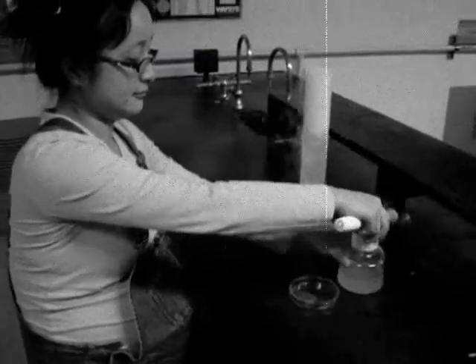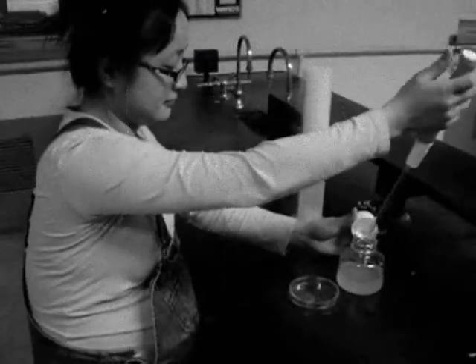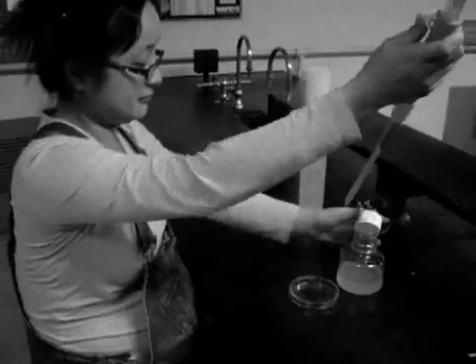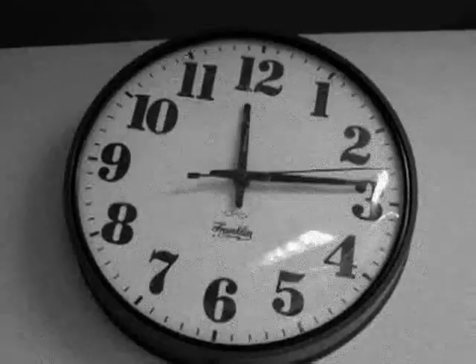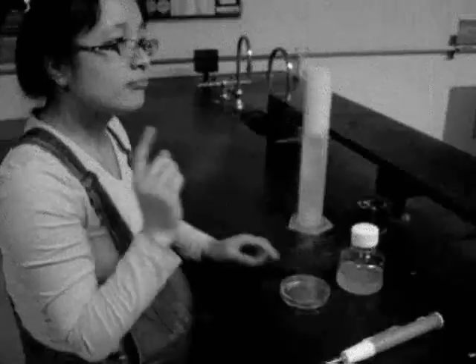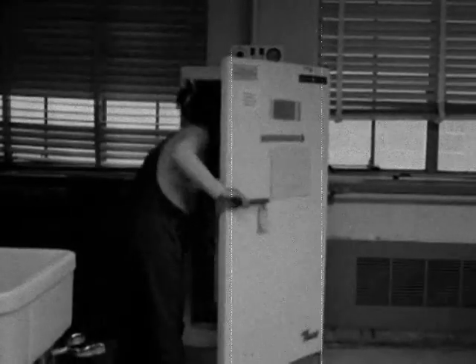Here's Jane, one of America's new female researchers. She leaves her bacteria on the bench as she goes to compute a logarithm.